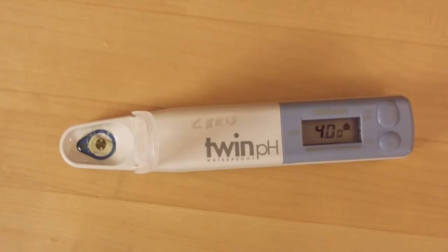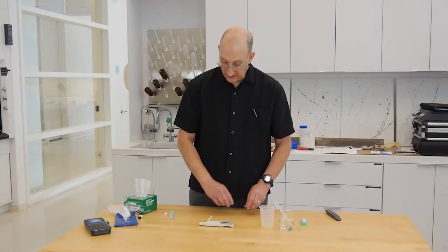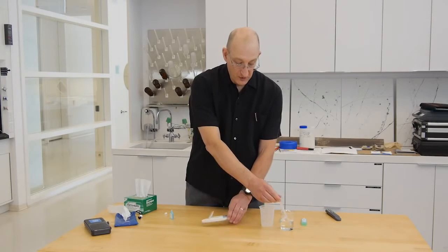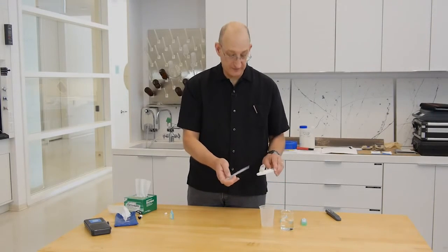Again, we wait for the happy face. We now have our happy face, and again, we just rinse with deionized water, and we're all calibrated. That's it.